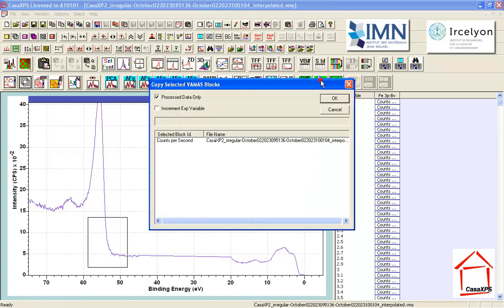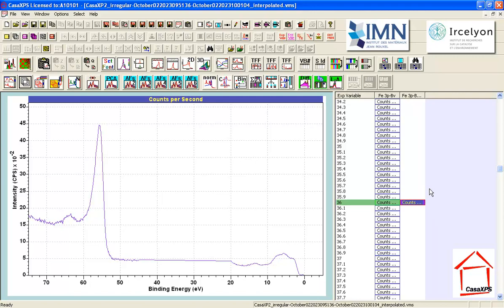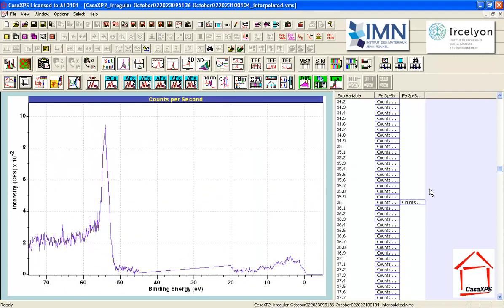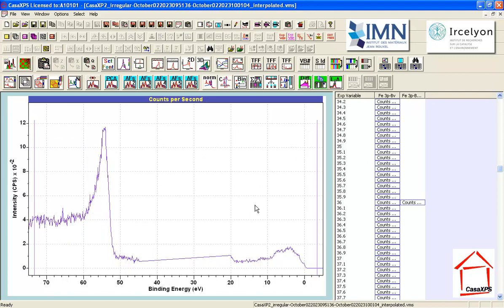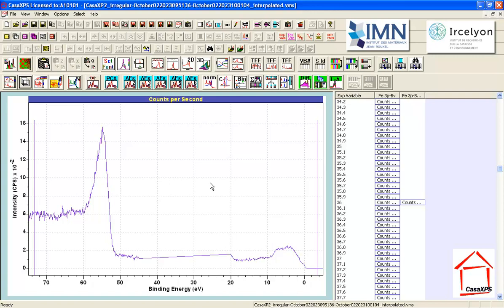So I'm going to take a copy, and this is bookkeeping. I've now taken a copy of the spectrum in this list that I thought was significant. I can step left with the arrow keys and then continue my search. And I need to keep going and accept that the different spectra will change in non-physical forms. And if I keep increasing, and let's just put some normalization on so that I can see both spectra clearly, both the valence band and the 3P, and I start to see something that looks again somewhat plausible and peak-like. And now I have a spectral shape which I consider to be different from the previous one.